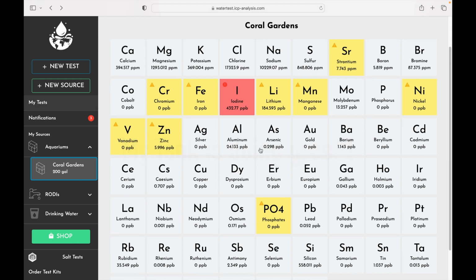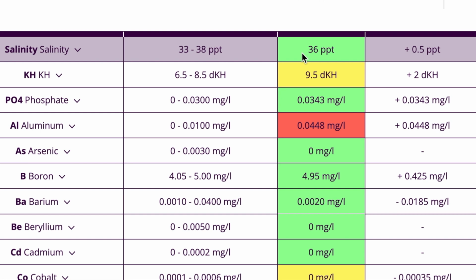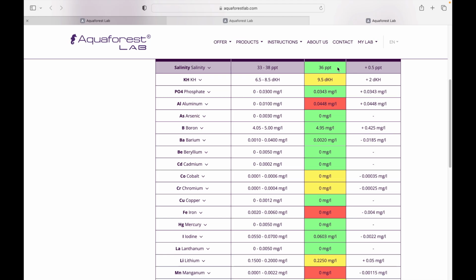Now that we have this, let's move on to Aqua Forest Lab and see what we've got going on with their test here, because their test is also in. So let's compare that. Aqua Forest Lab here. Let's have a look. So the salinity actually is a little high. Yeah, I knew it was creeping up a bit there, so I'll adjust.